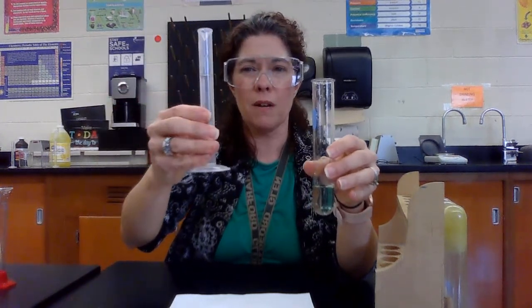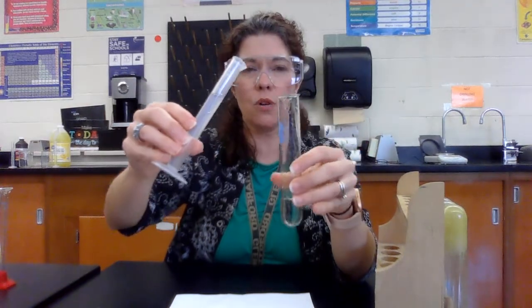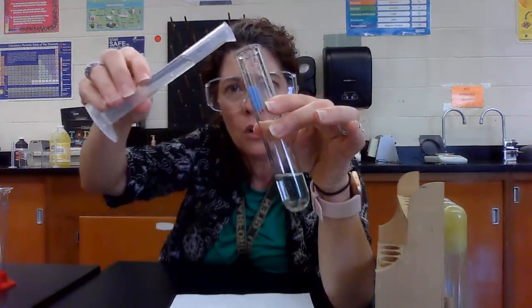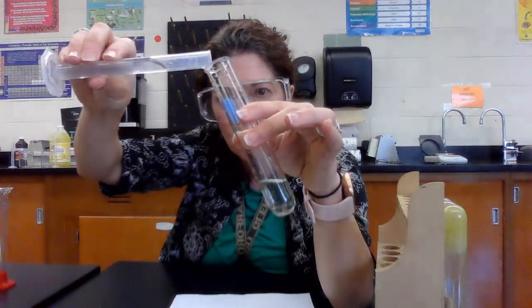And to that we are going to add 10 milliliters of sodium carbonate. Here is our sodium carbonate — again it's just a clear liquid. I'm going to add it pretty slowly and I want you to watch the test tube.